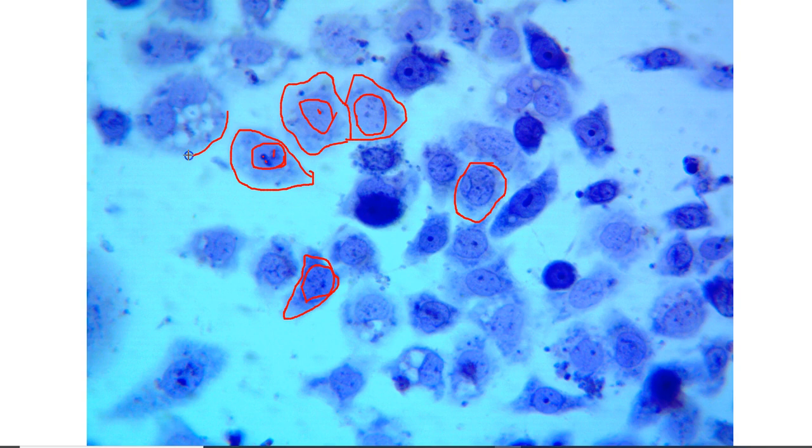And then you have some cells that are going to go through necrosis. Here's a multinucleated cell with lots of empty vacuoles. And right now the nuclei are still intact, so I would just call it a multinucleated cell. But because of the vacuoles, you know that the cell will eventually die through necrosis. Here's another typical cell, lots of cytoplasmic space, nice clean nucleus, and then your nucleoli inside.